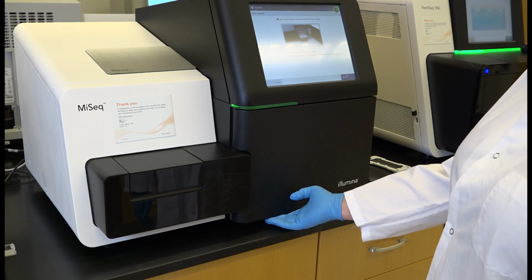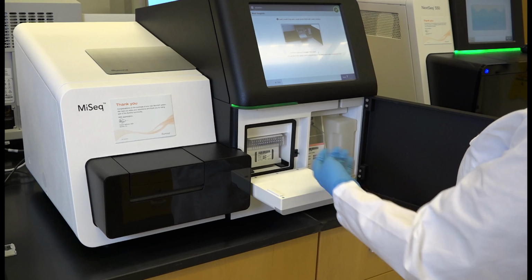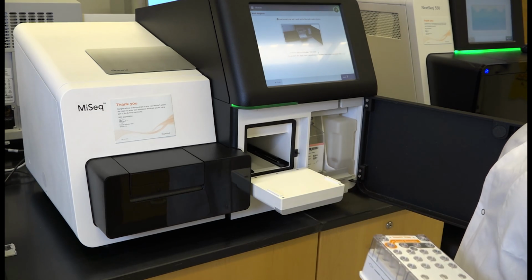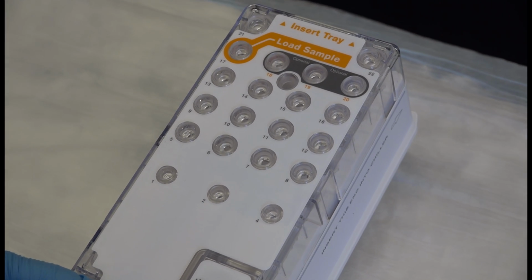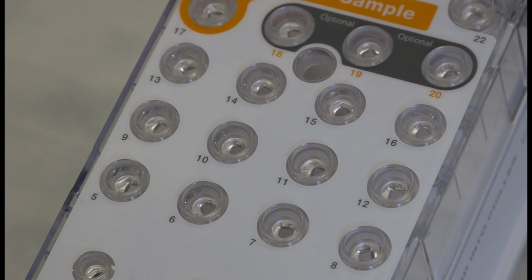To resolve this issue, power cycle the instrument and unload the reagent cartridge, the flow cell, and the incorporation buffer bottle. Inspect the foil seals on the reagent cartridge to see if they are punctured. Check if the puncture holes are aligned to the center or slightly misaligned and off-center, which could indicate misalignment of the cartridge in the reagent chiller.